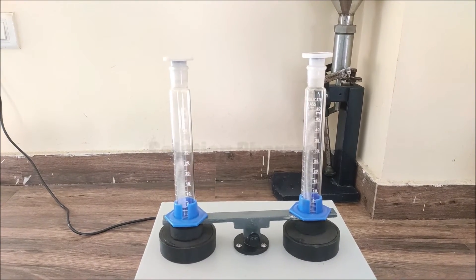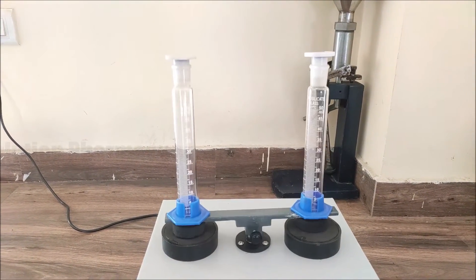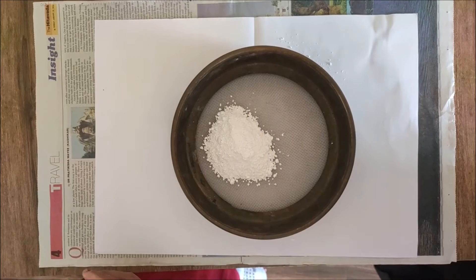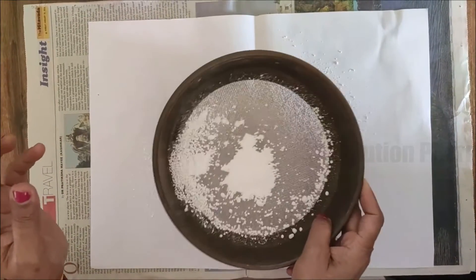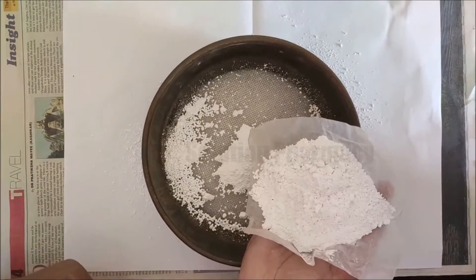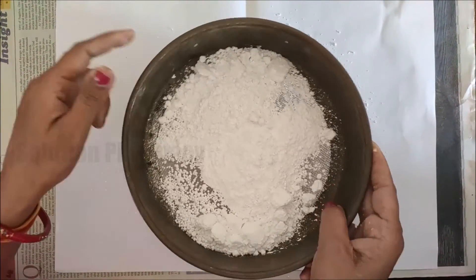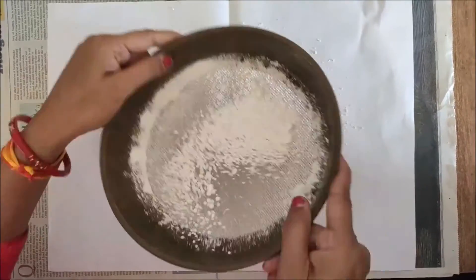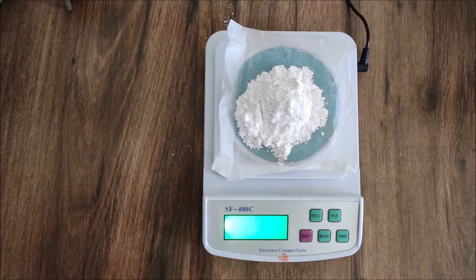Now I will show how to determine the bulk density of any powder using the bulk density apparatus. First, take the powder whose bulk density you want to determine, then pass it through US standard sieve number 20. Here we have taken some amount of powder, passed it through sieve number 20, and transferred an extra amount because we need to fill both measuring cylinders equally. We have taken calcium carbonate powder. After sieving, we weigh the powder — here we have weighed 25 grams for each measuring cylinder.